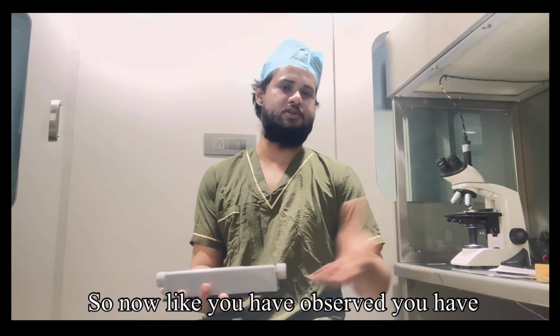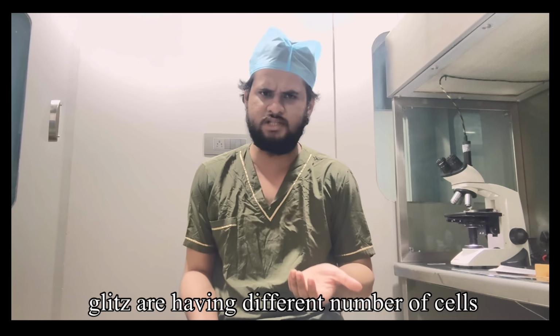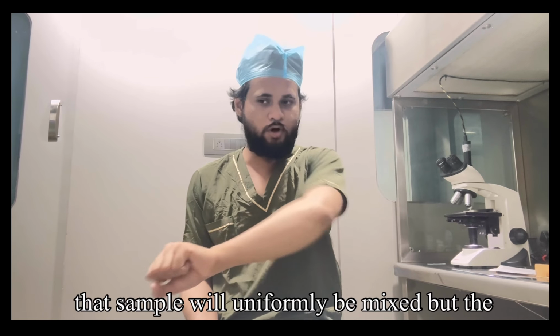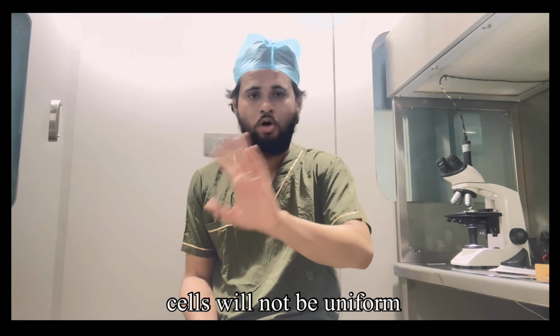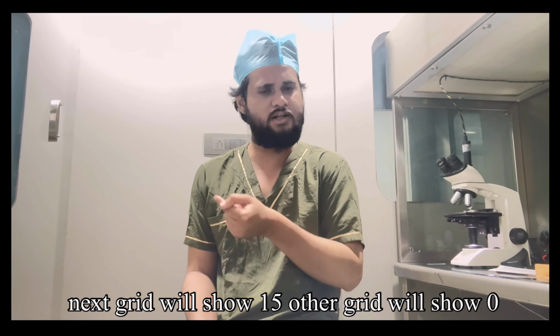Now, as you look into the microscope, each grid has a different number of cells. You are loading a sample and that sample will be uniformly mixed, but the cells will not be uniform. One grid will show 10, another grid will show 5, the next grid will show 15, another grid will show 0.